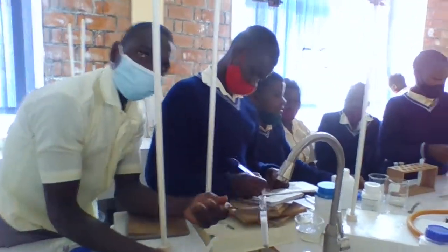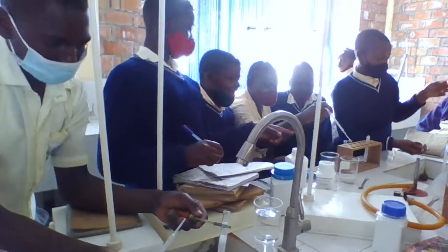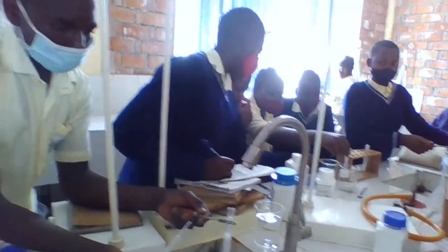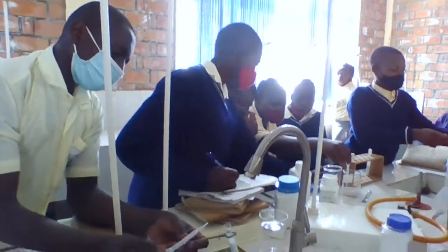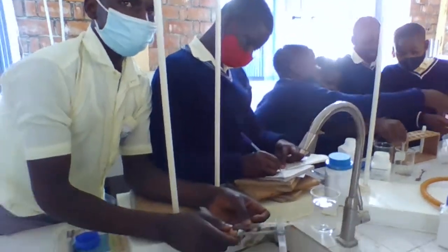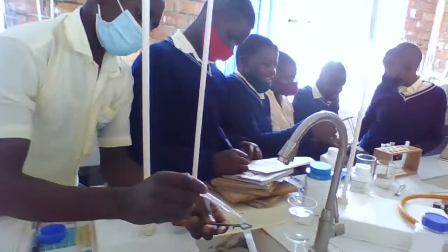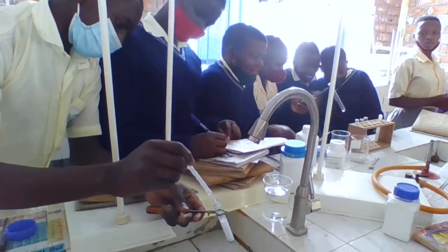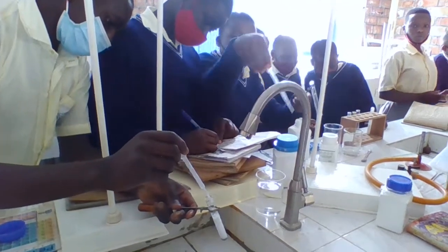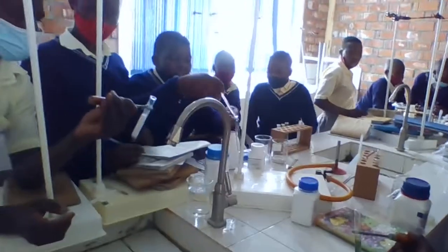Is it sounding? Okay. It is necessary to observe. And the color? The gas. Was it evolving? Continue to put in. Put in again. Until excess. Excess. You are somehow late. It was late.